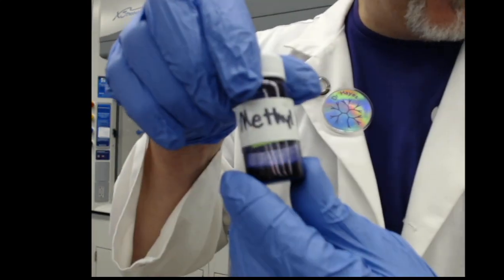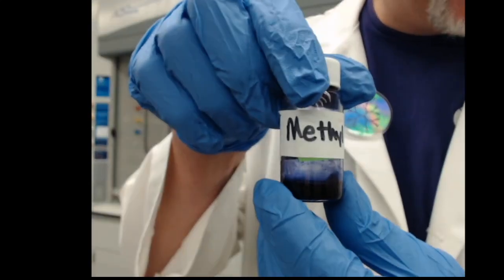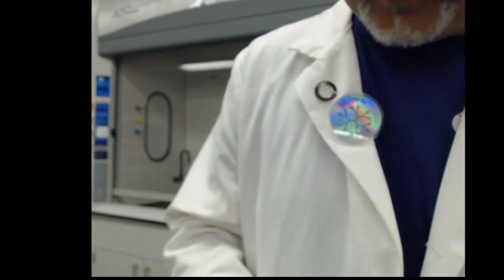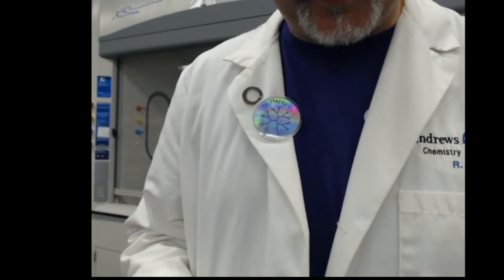All right, in this lab we're going to run an equilibrium Le Chatelier's principle test with methyl violets. And all you need for this is a test tube.